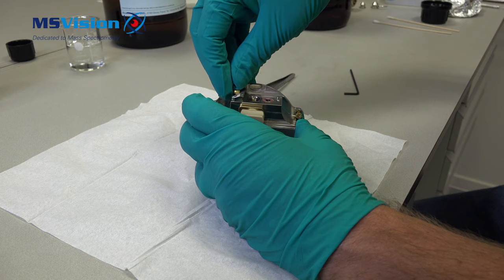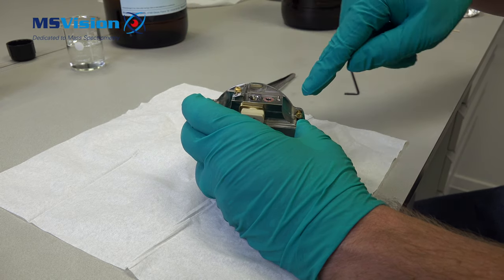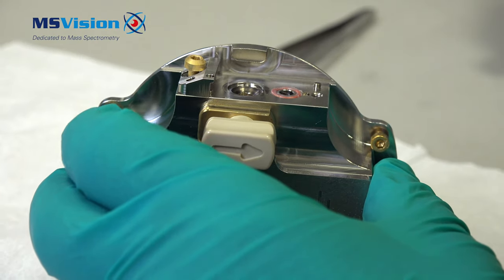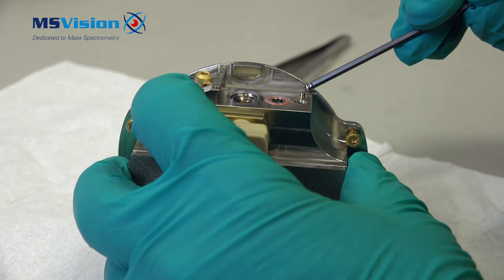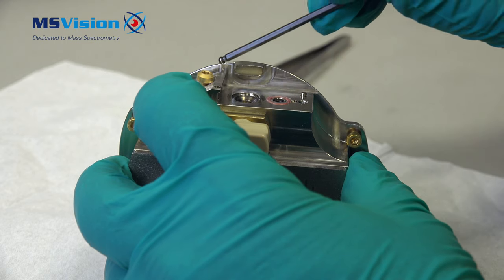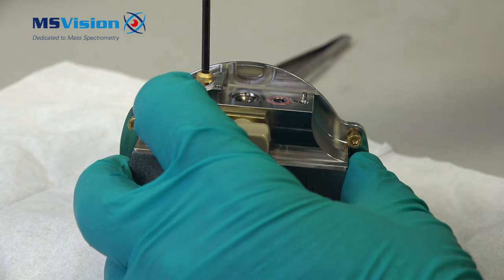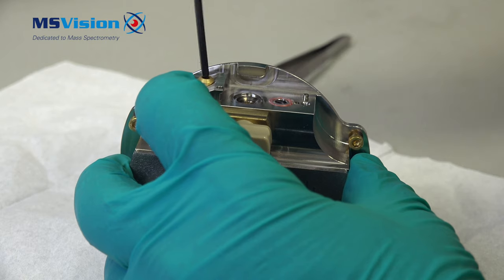Now I can put in the screw and screw it down on the source block. You will see a locating pin along with the hole for the screw. Here's the pin and the screw hole. These should be no more than hand tight. Any more then the spring has no function.